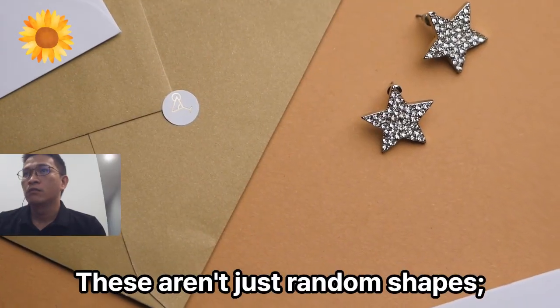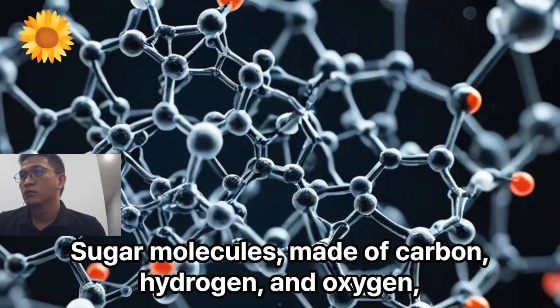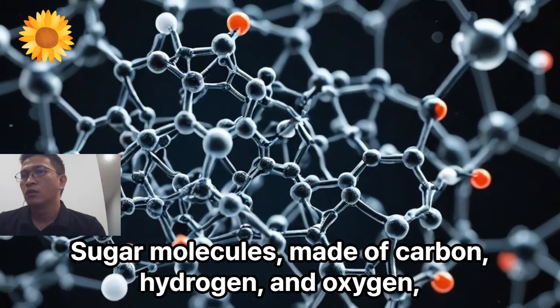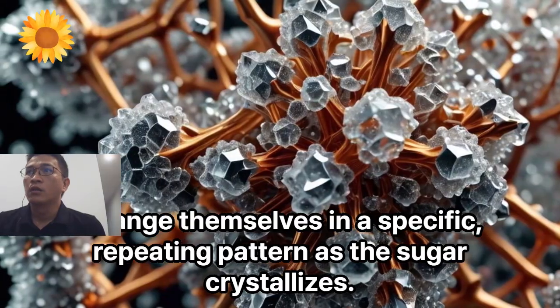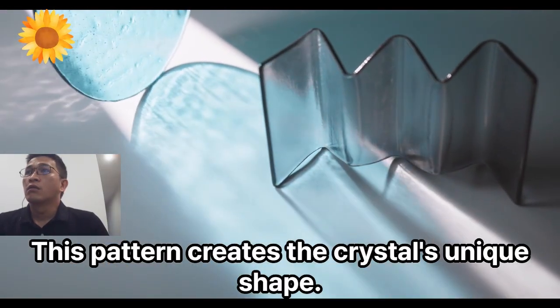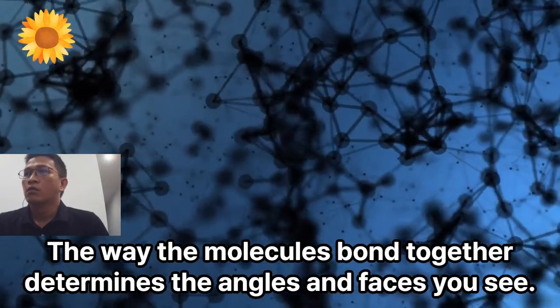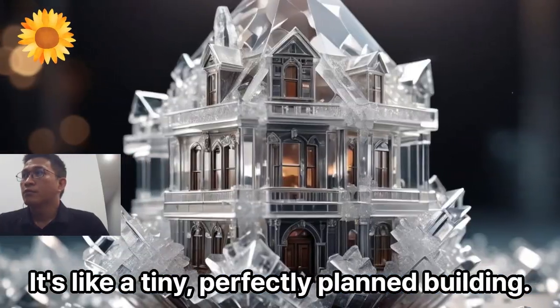These aren't just random shapes. They're the result of a highly organized process. Sugar molecules made of carbon, hydrogen, and oxygen arrange themselves in a specific repeating pattern as the sugar crystallizes. This pattern creates the crystal's unique shape. The way the molecules bond together determines the angles and faces you see. It's like a tiny, perfectly planned building.